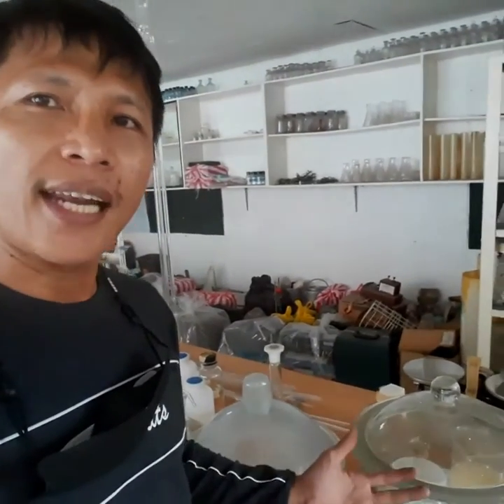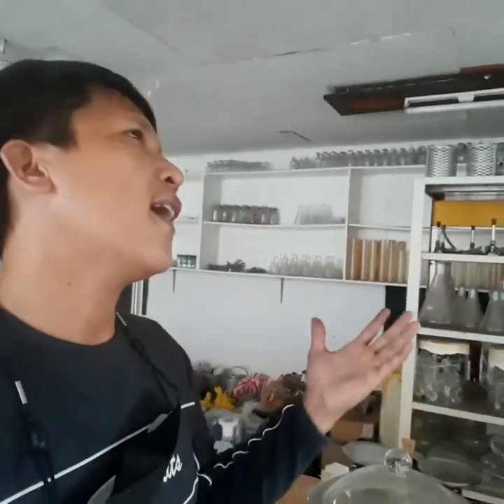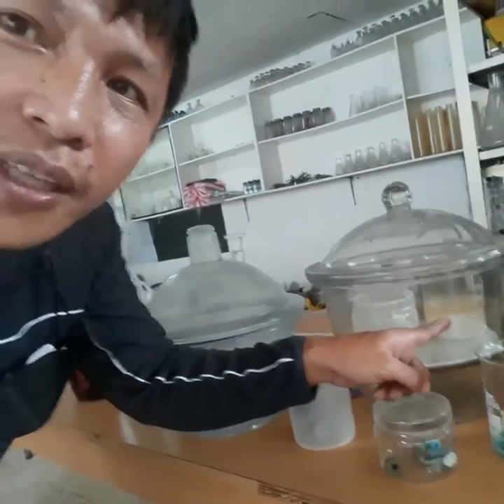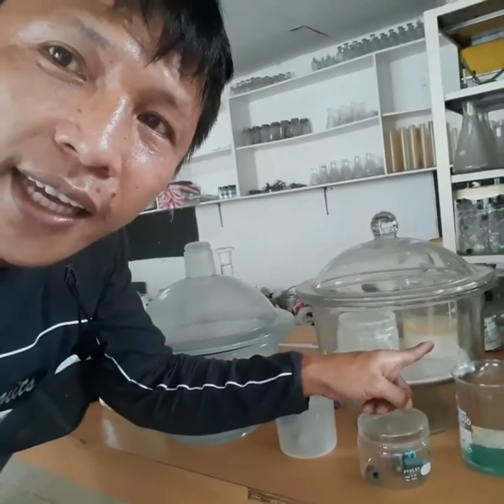Because the purpose of your desiccator, from the definition, is that it must not accept moisture. Of course, that's the use of your desiccator. You put materials inside the desiccator if you want them not to be contaminated with moisture, meaning the air which has water in it. Your desiccator actually has a setup also because it needs a desiccant. As you can see, I have a desiccant here. I think that other one I just bought from the internet. I think that desiccant is calcium chloride.